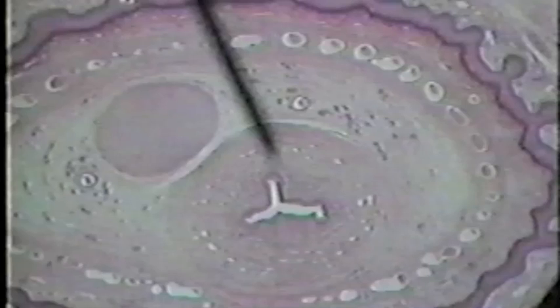Here we see a cut through the immature penis. The pointer is indicating the penile urethra. Surrounding the penile urethra is the corpus spongiosum. Here we see the developing corpus cavernosum.